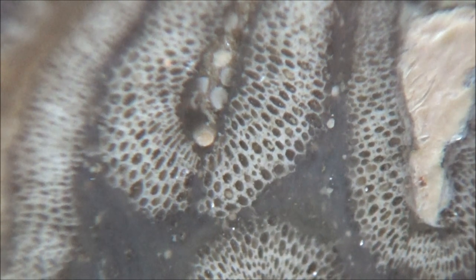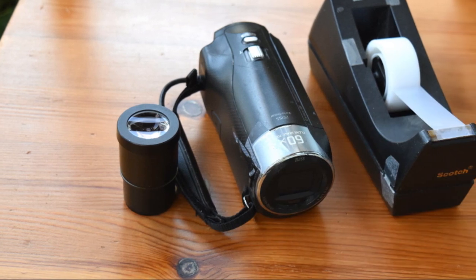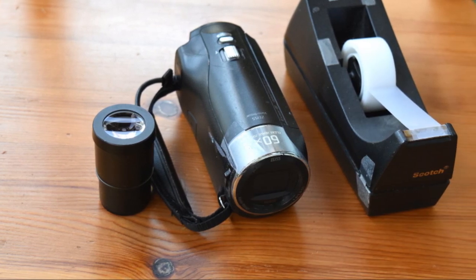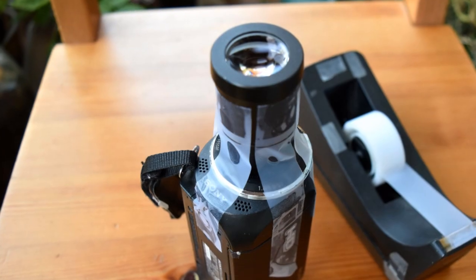Hi and welcome to Koi Channel. This time we will do a deep dive into the micro world using a very simple device made from a video recorder, an eyepiece lens of a microscope, and an office tape.